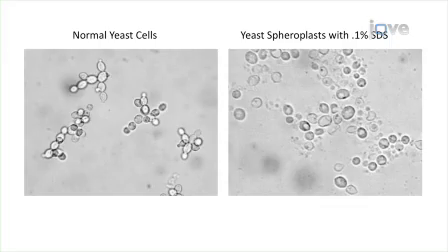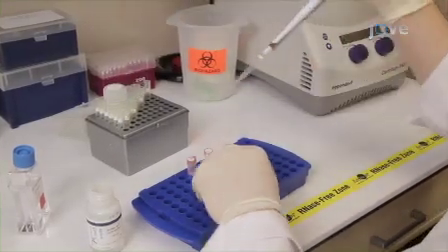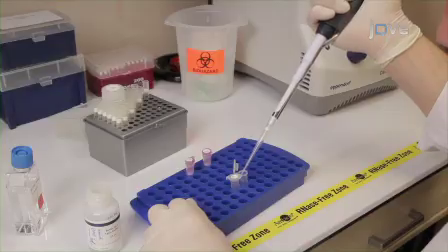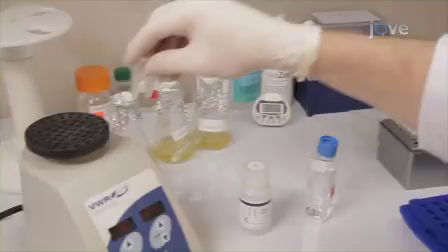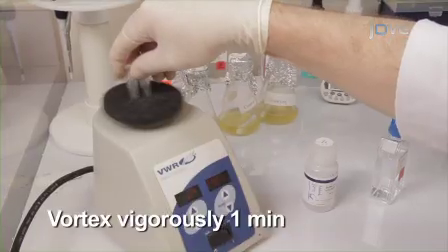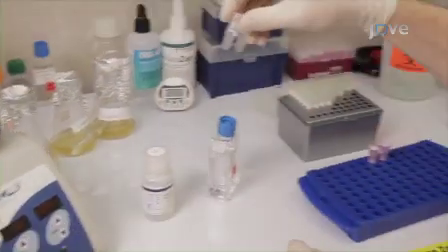If partial spheroplasting is observed, an extended treatment with lyticase is recommended. Once complete spheroplasting has been confirmed, add 350 microliters of RLT buffer to each tube. Then add 250 microliters of 100% ethanol. Ensure the tube is tightly capped by holding the lid closed and vortex vigorously for 1 minute. This procedure will lyse the spheroplasts.